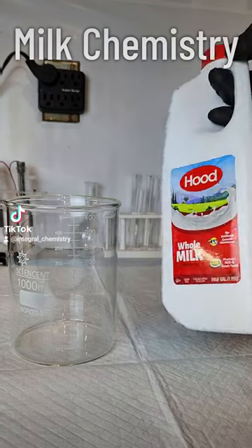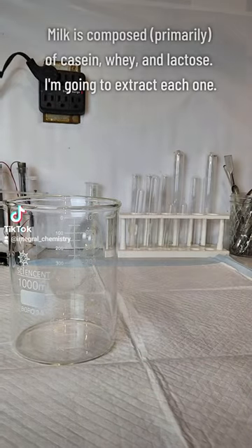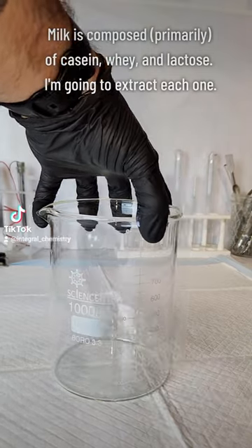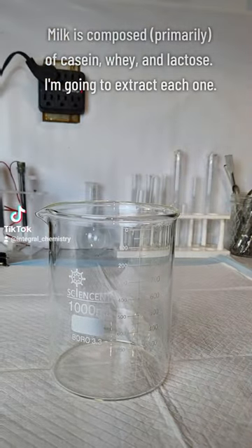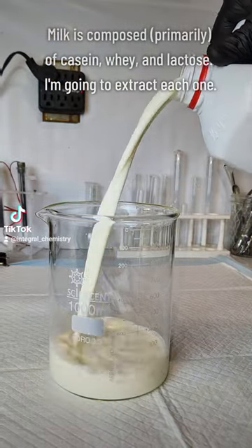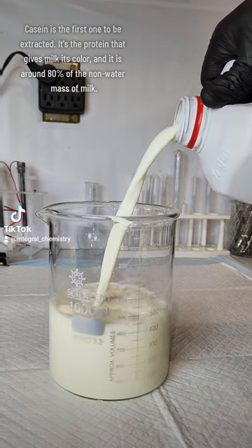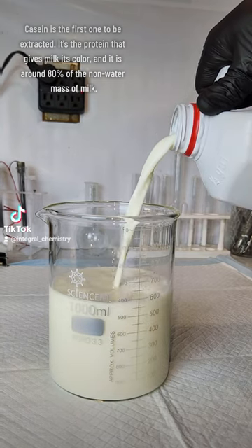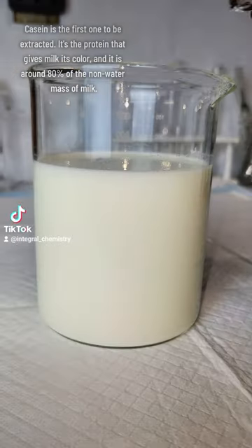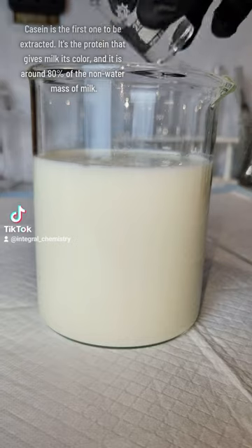Milk is one of the most widely produced food items on earth, with over 6 billion humans relying on cow's milk as a primary source of nutrition. Despite this, most people don't really think about what milk is made of, so today I'm going to extract the primary components of milk, starting with casein.